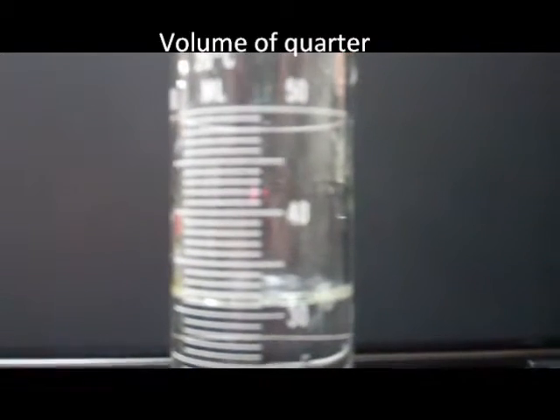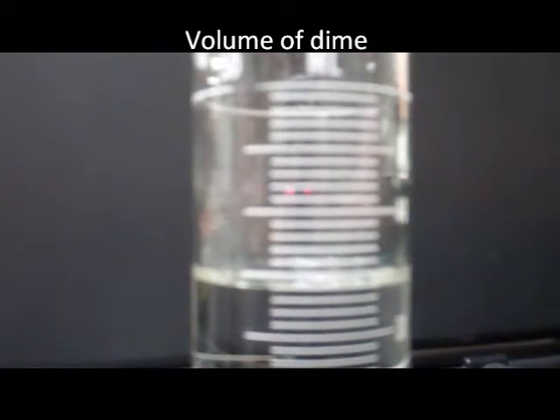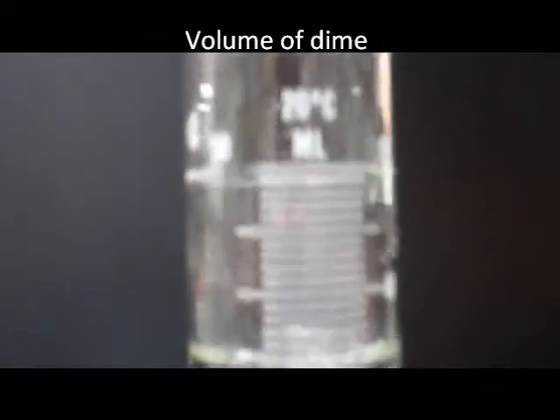I'm going to start with 31 milliliters of water. Now there are 38 milliliters in the graduated cylinder. I'm going to start with 34 milliliters of water. It went up to 37 milliliters of water.